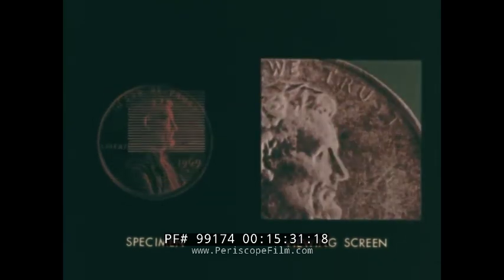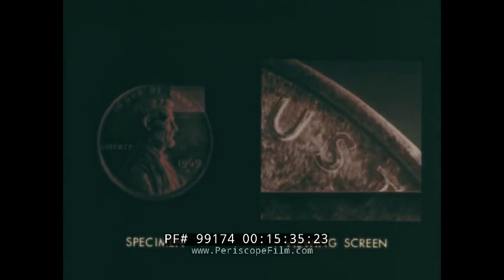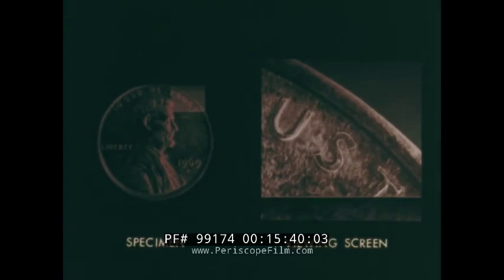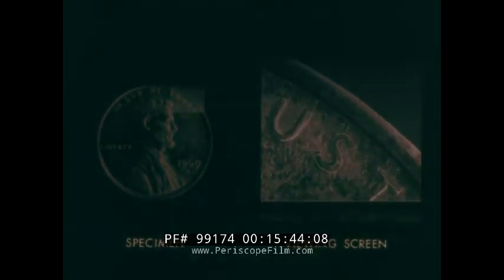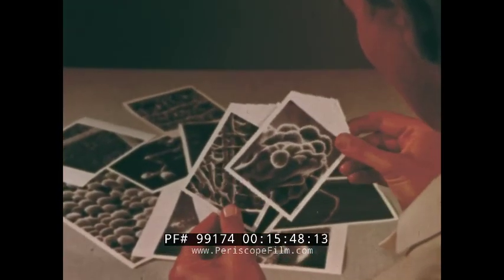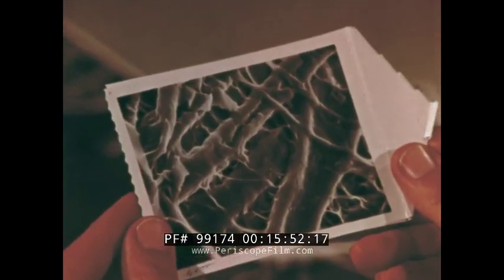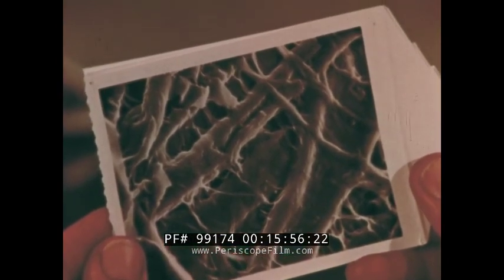To obtain magnification, the points and lines formed by the probing beam are packed closer to each other, so that only a portion of the specimen is scanned. Suppose we show you, as a kind of scientific game, some of the revelations of scanning electron microscopy and give you a couple of seconds to guess the answers.